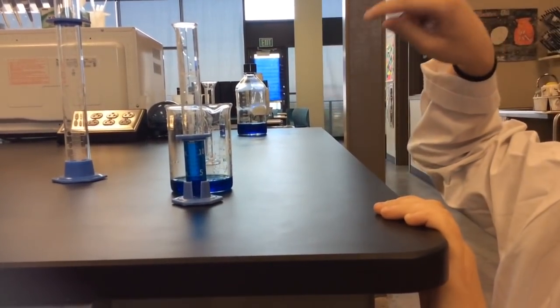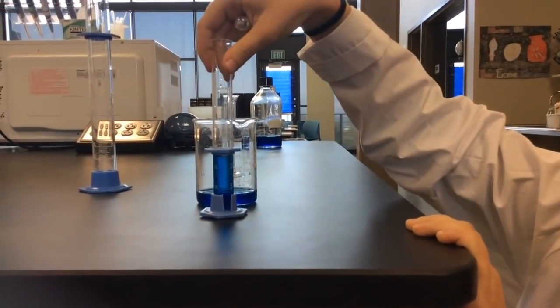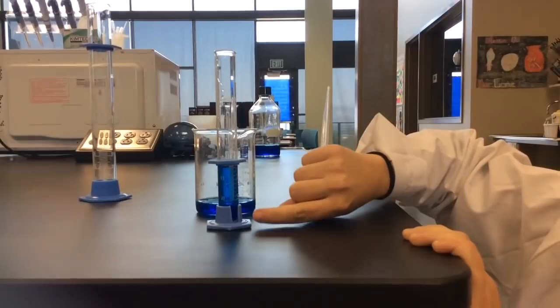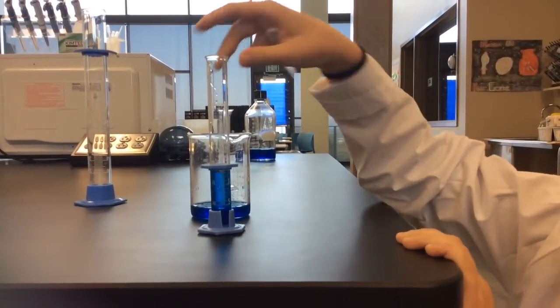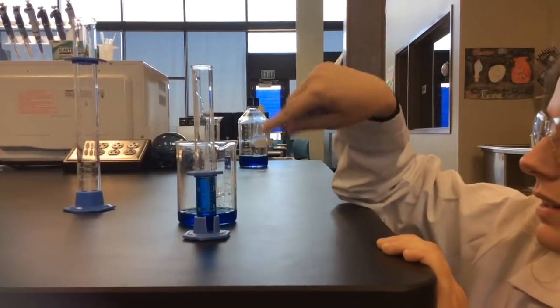Again, with micro pipettes, it's similar. There's a measurement that goes from bottom to top and top to bottom. So make sure that you are going to do from the bottom to the top. So this shows that we are measuring out 15 milliliters of this blue solution.